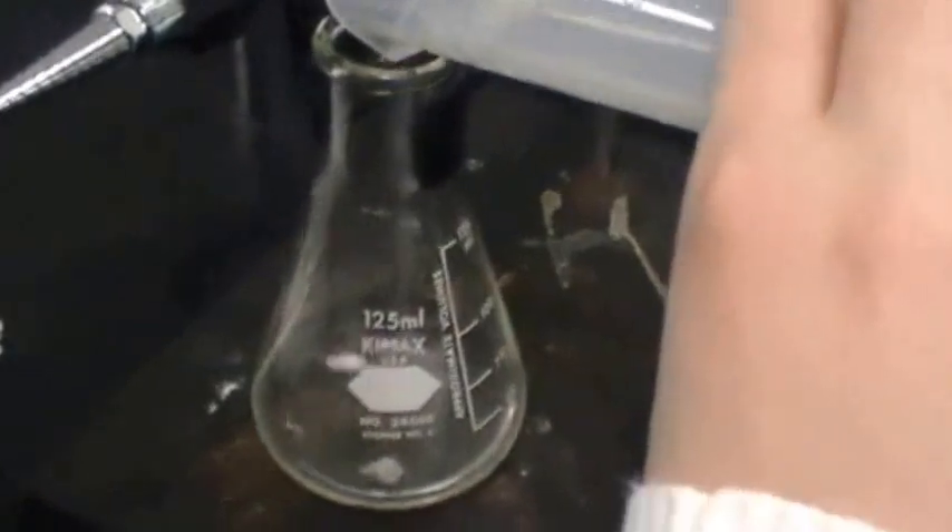Does that mean you have to do that at all times? Yes, at every minute you're meant to do this. We're starting a timer, and at every minute we'll re-measure the volume of the gas from the top.